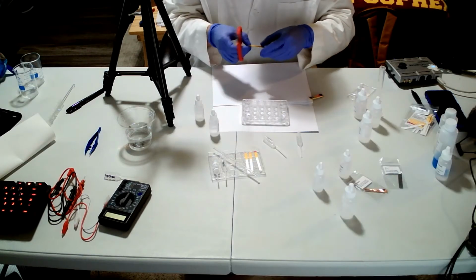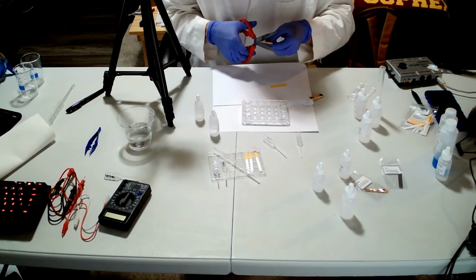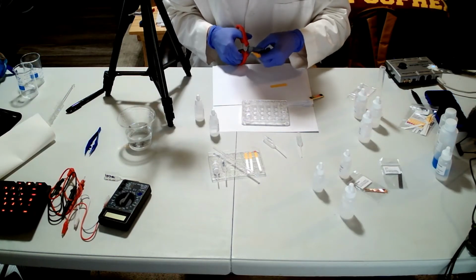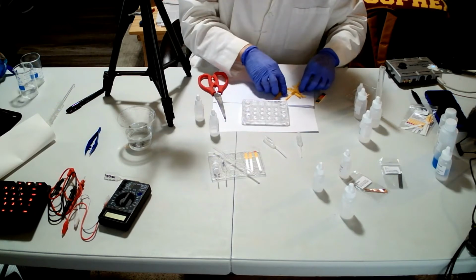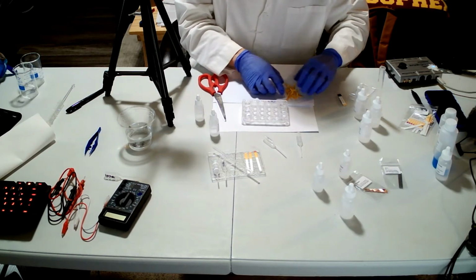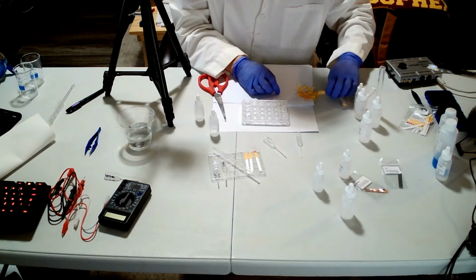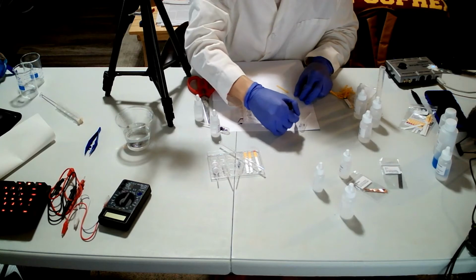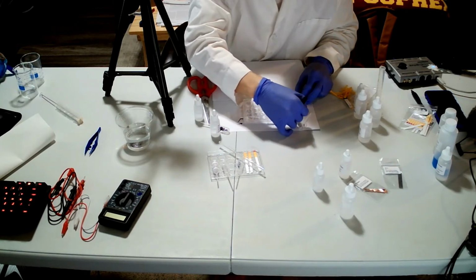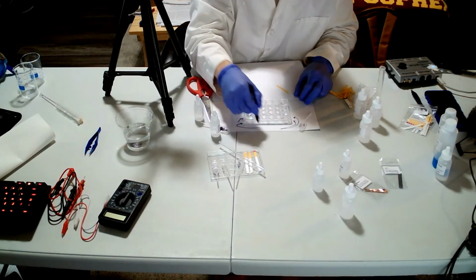So, right, I'm gonna cut this in half, right? So I just cut those test strips in half. Just place it in the clean space. Those are buffer. They're all buffers, right? A1, A6. Those are all buffers.